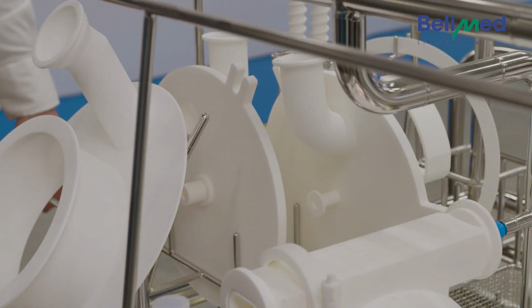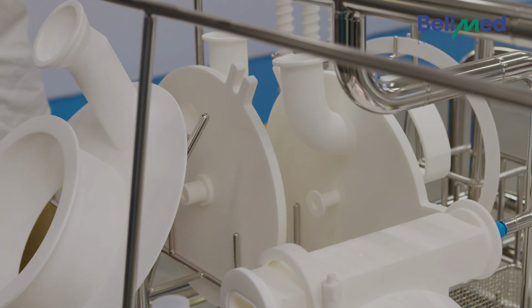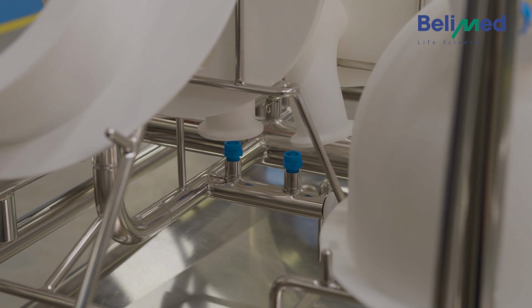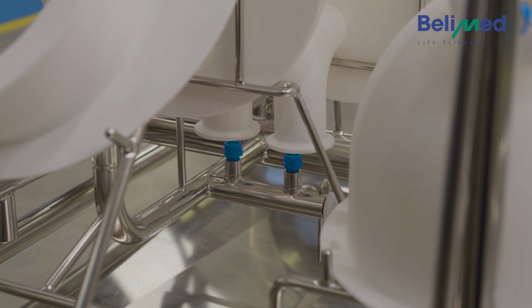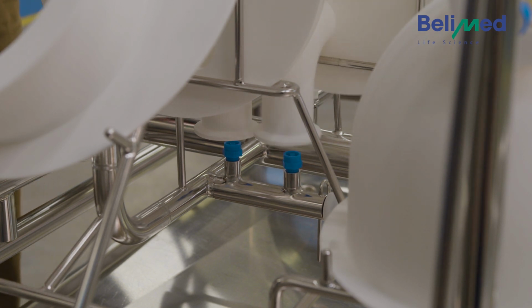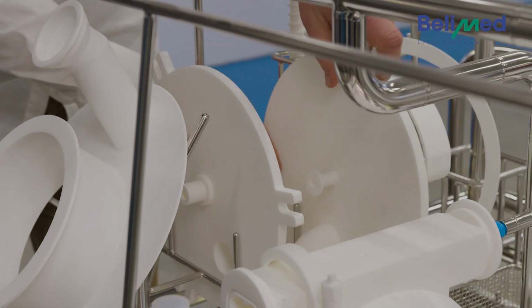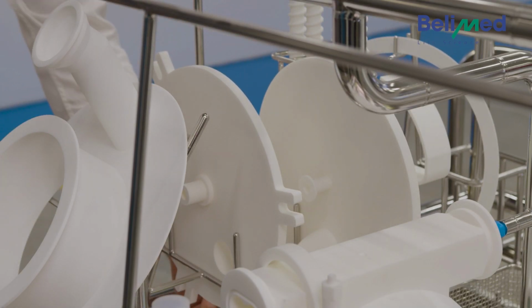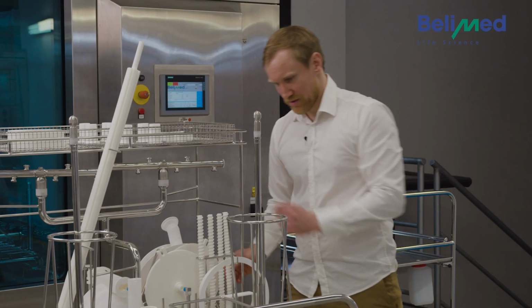These two parts are also not positioned correctly. First of all, it would have been way easier to assemble them first before you place these parts and this part. If you remove them, you see down there are two nozzles. So actually, correctly placed, it would be like this. And this one here, like this, so the nozzles can directly clean these parts from the inside. Again, really hard to see on the loading scheme.